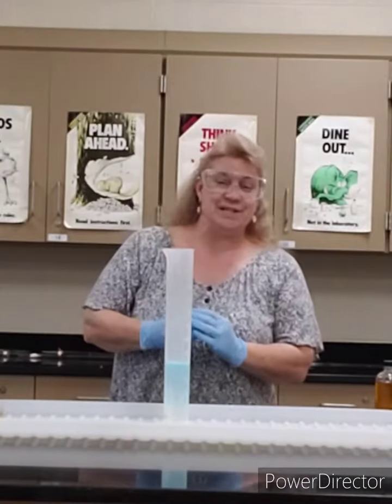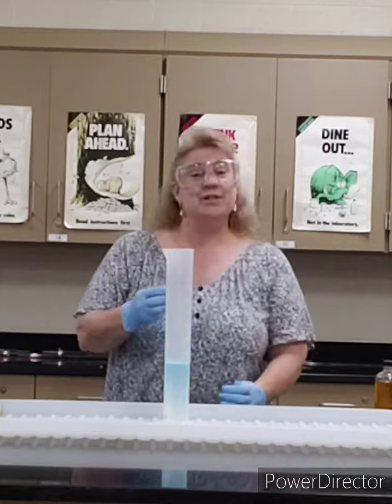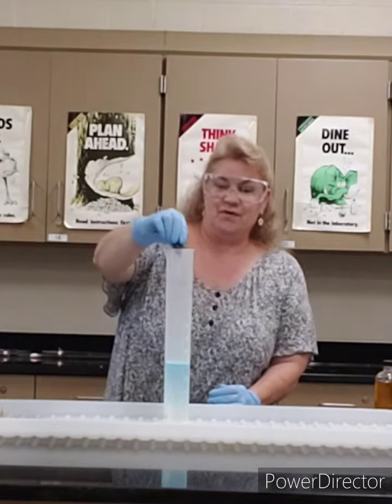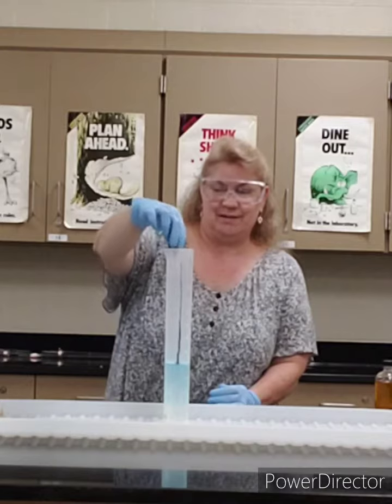This demonstration is sometimes called elephant's toothpaste. So we're going to add a little bit of food coloring to make it look like toothpaste.